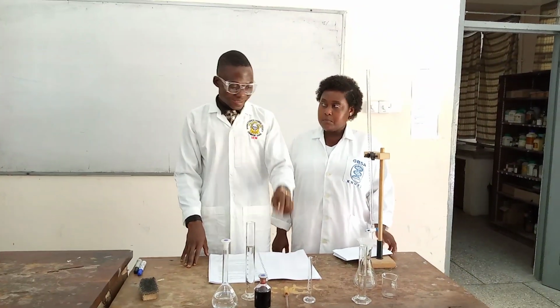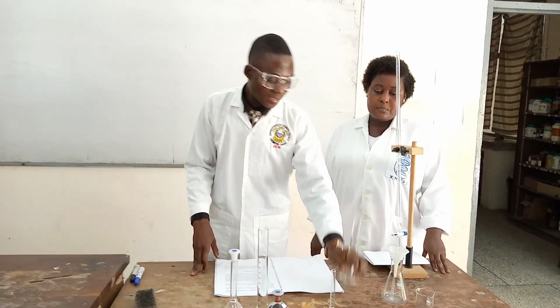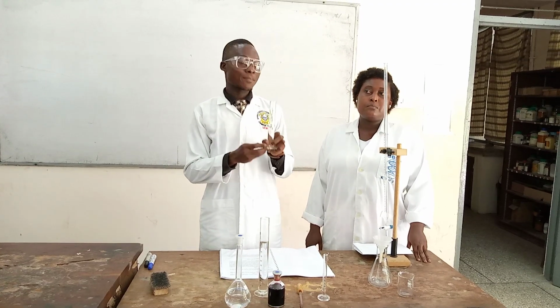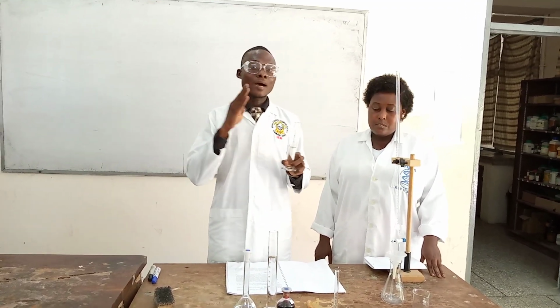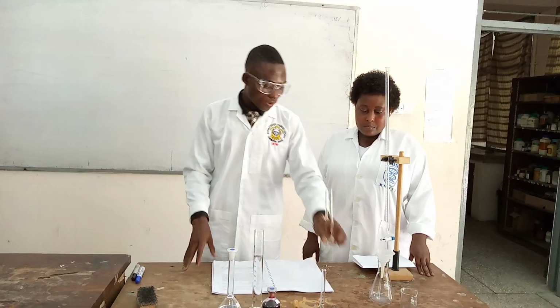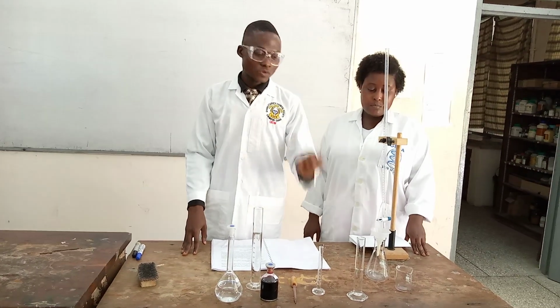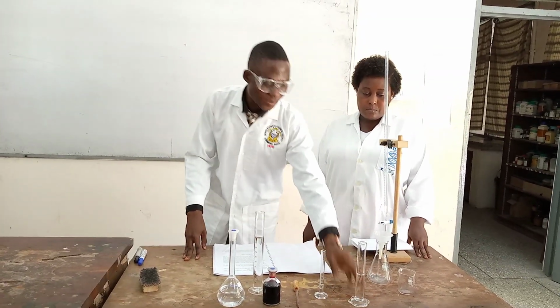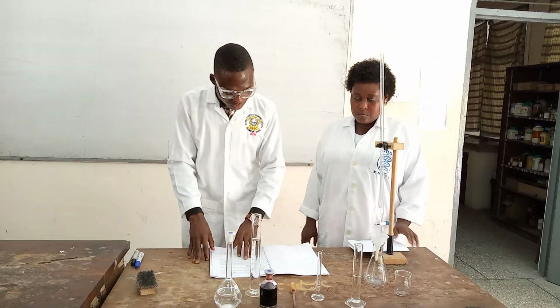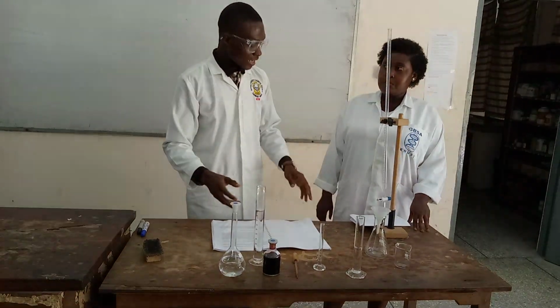But please, I forgot to mention one chemical earlier on. That is, you also need a buffer solution in the practical, and the buffer is made up of what? Ammonium chloride in ammonia, which is supposed to give you a pH of 10. Maybe in the process of preparing, we'll make sure that all this comes into consideration.